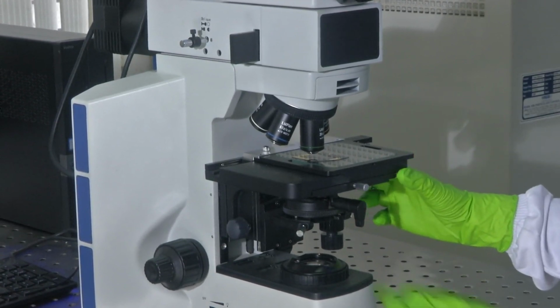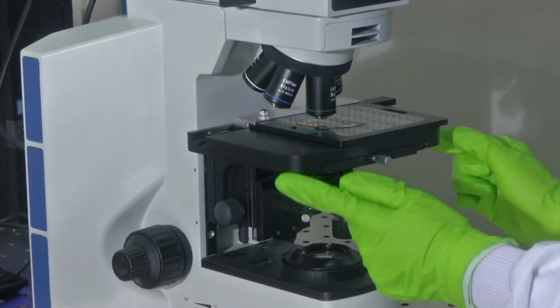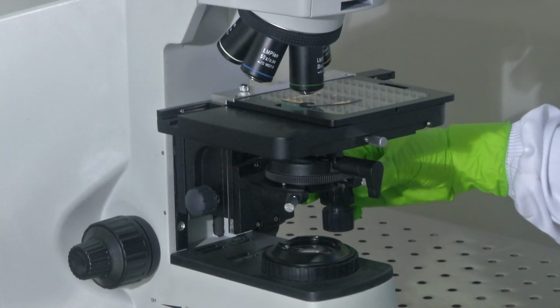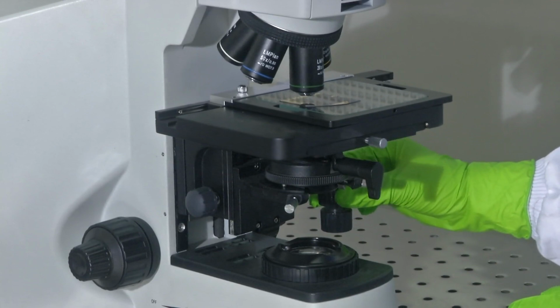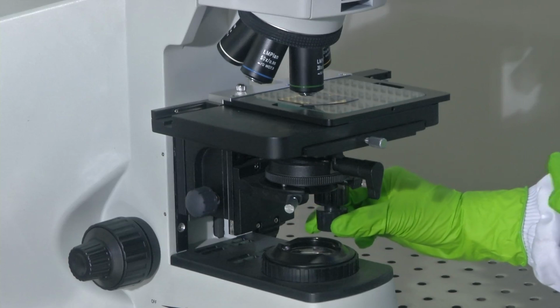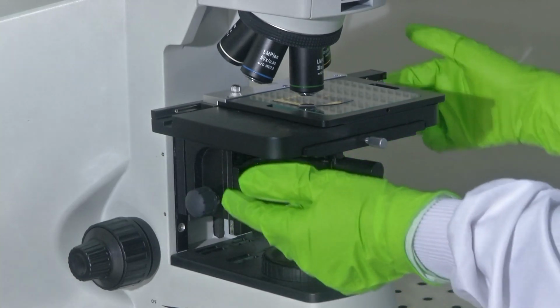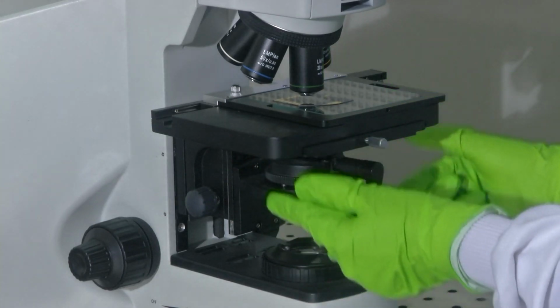And here this is the stage, the sample stage where the sample sits. The stage could be moved in x, y and z direction. There is a knob at the right which I am operating for it to move in the y plane, and similarly, as you can see, I am moving it in the x plane, x, y, and you could also move this entire stage in the z direction.